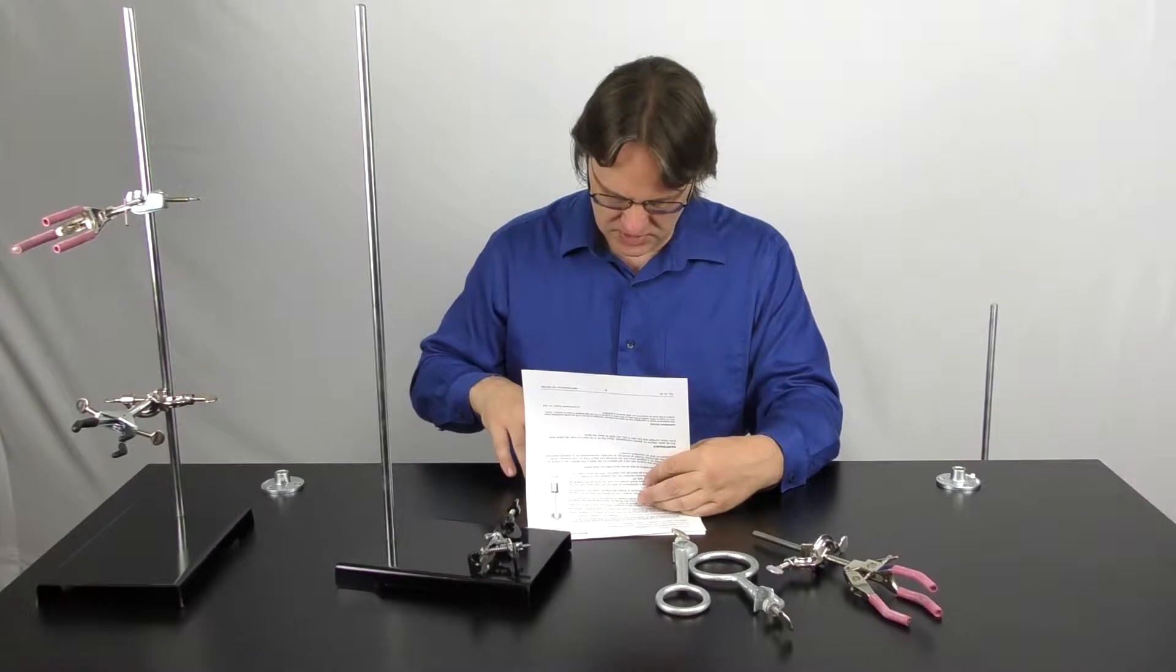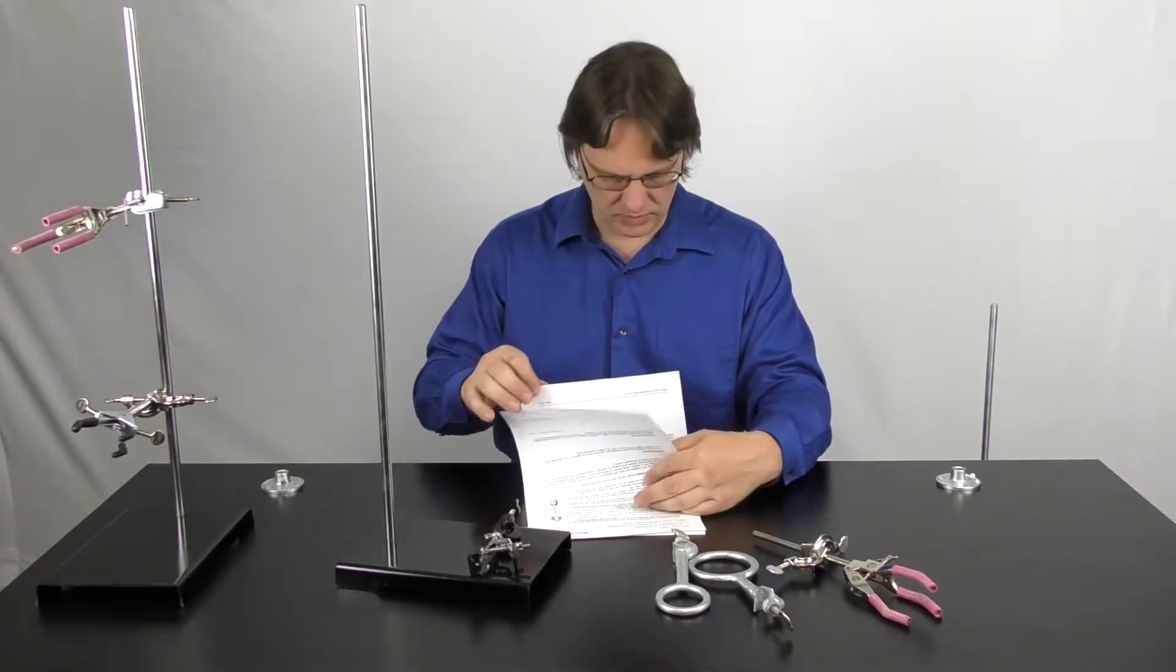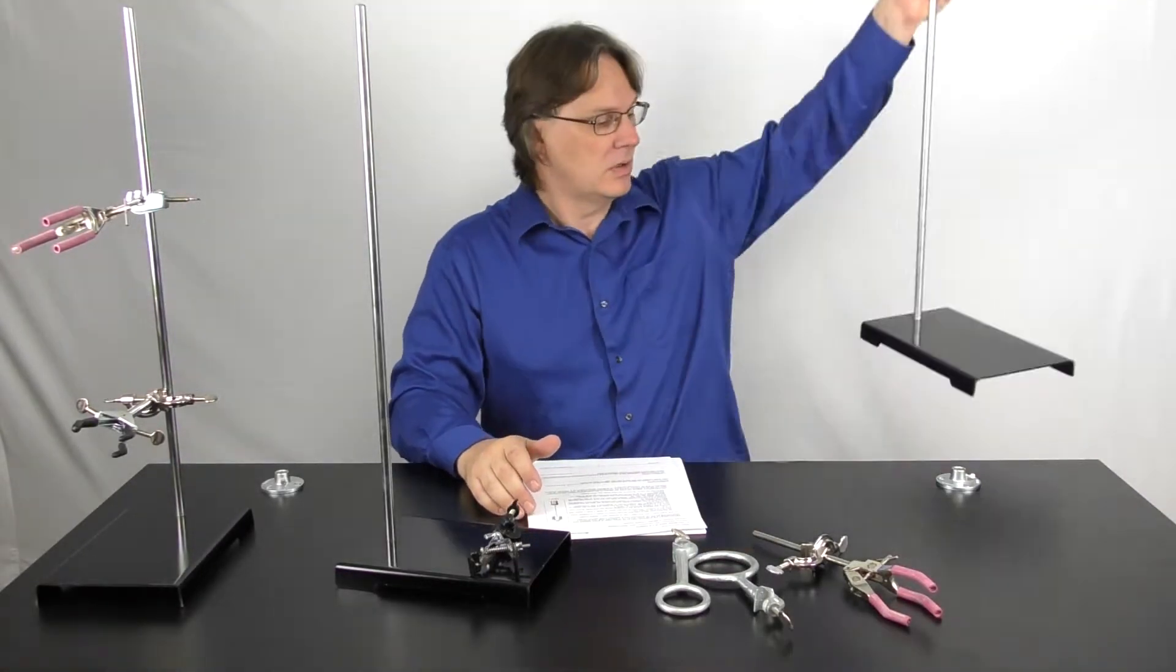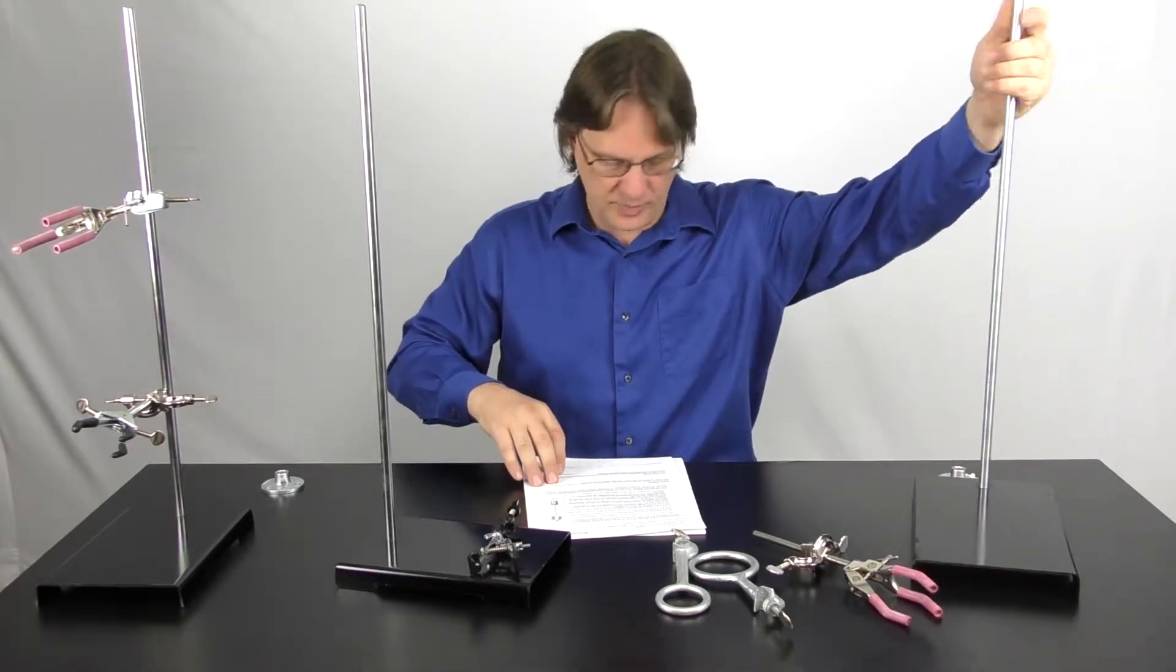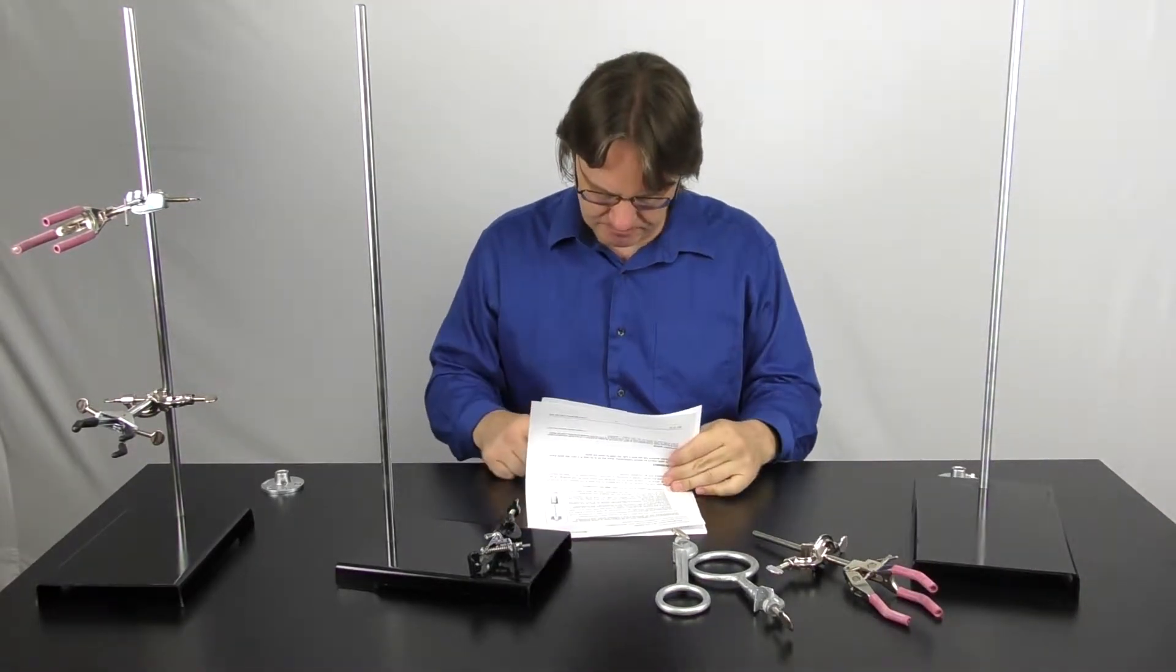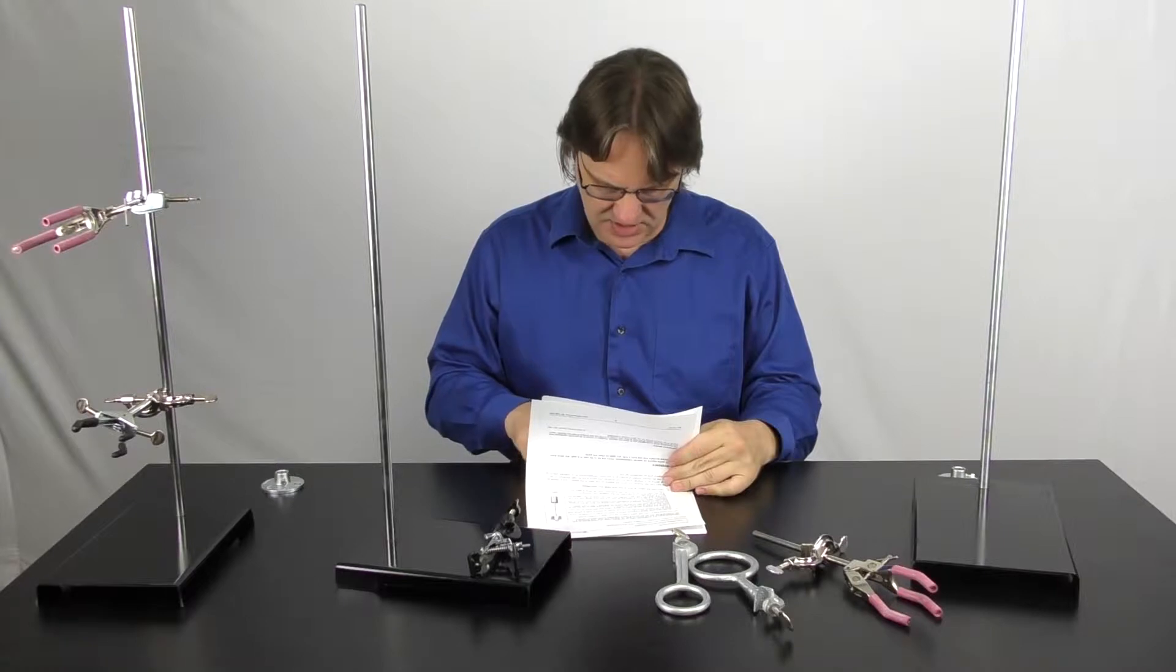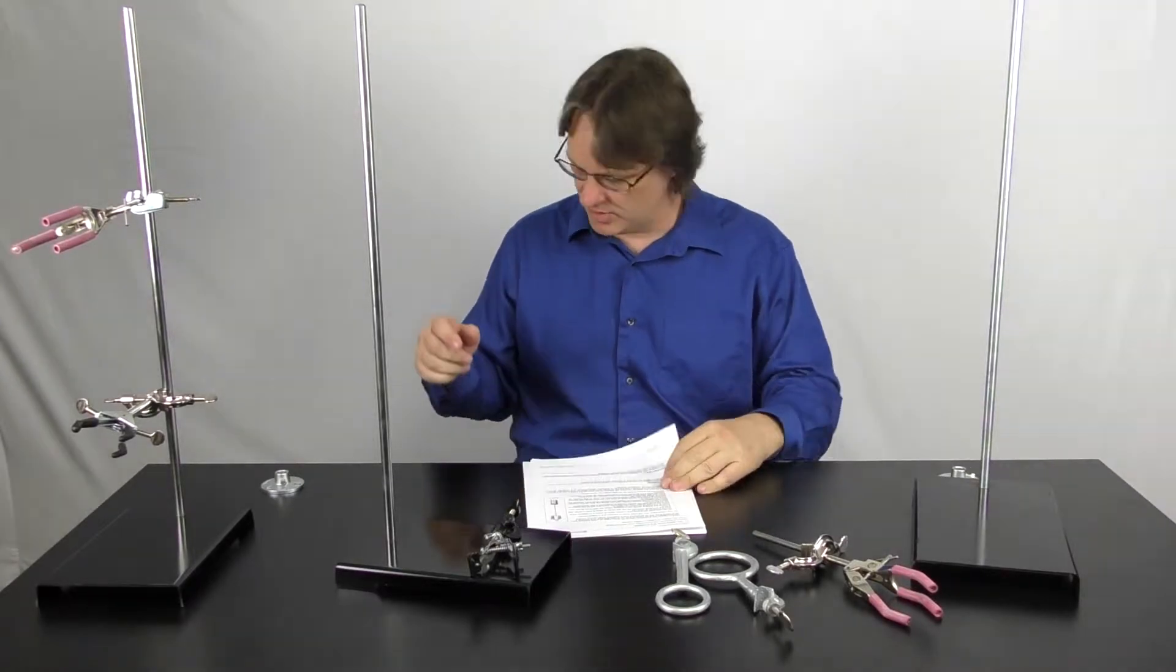I need a tall separatory funnel on the beaker to catch it, so that'll be good. I should set that up now to make it easier later on.